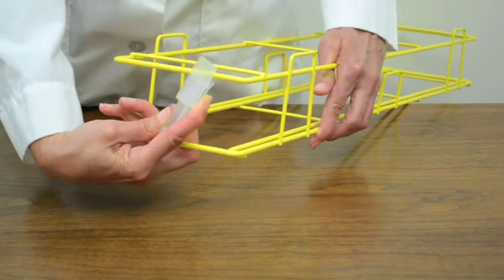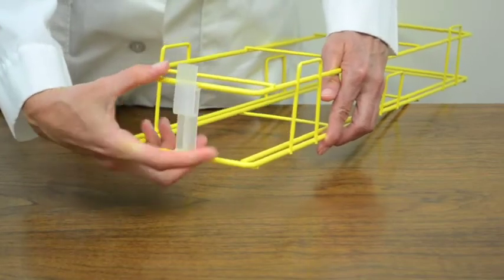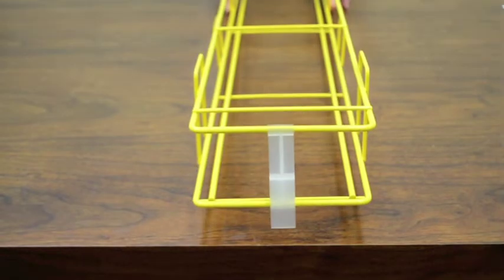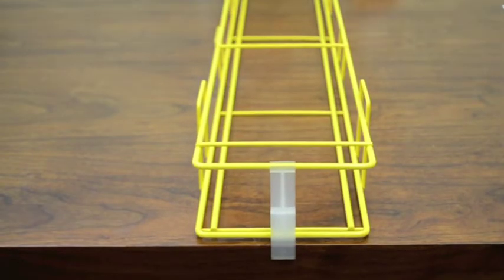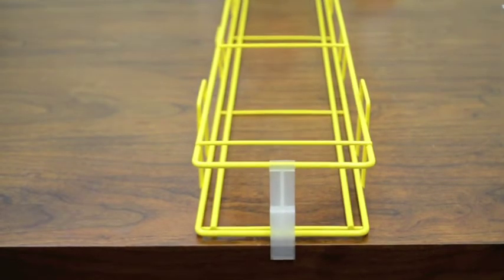Install the clips as needed based on the frame's location in the freezer. When placing bottom frames in the freezer, this tab should be inserted between the freezer shelf and the back wall of the freezer.